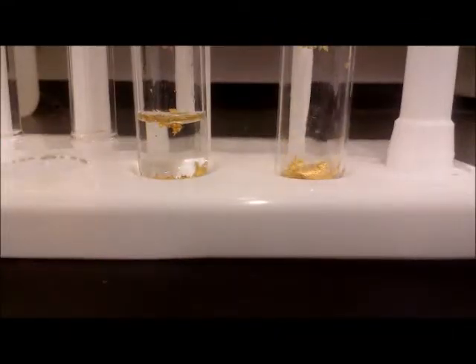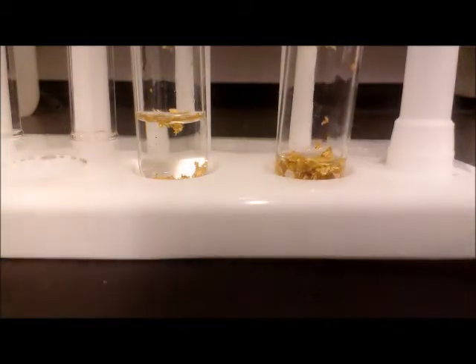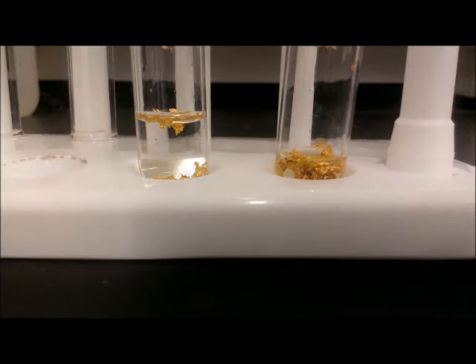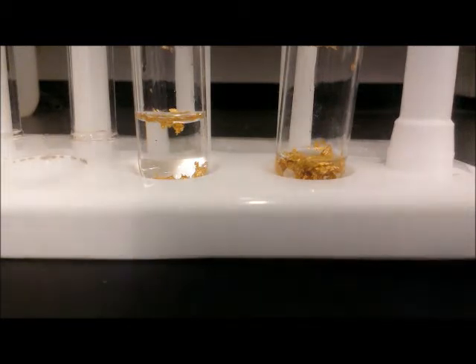I first add nitric acid to the gold in the test tube. After doing that, I add three times that amount of hydrochloric acid.